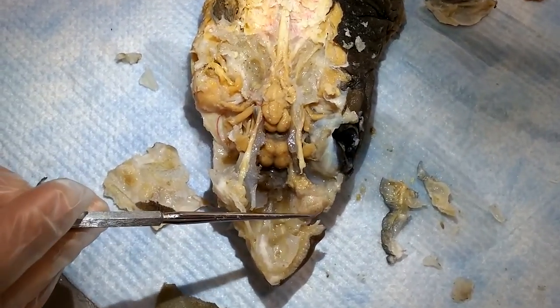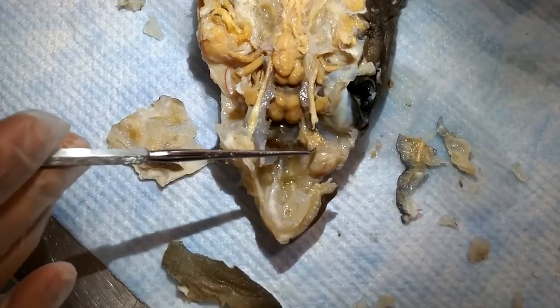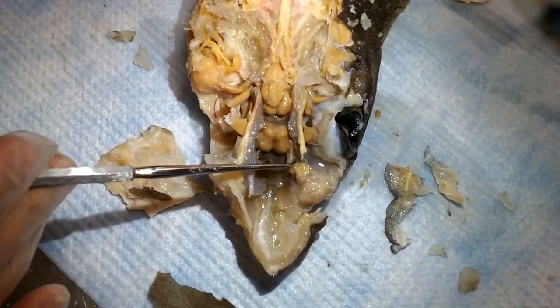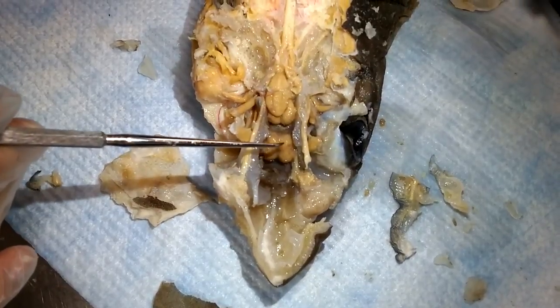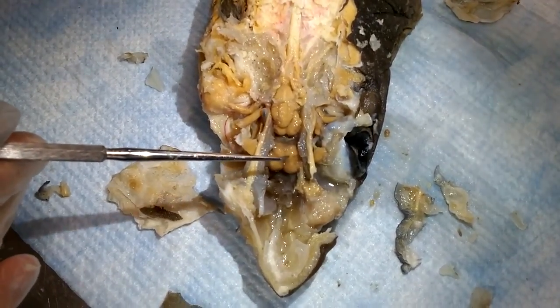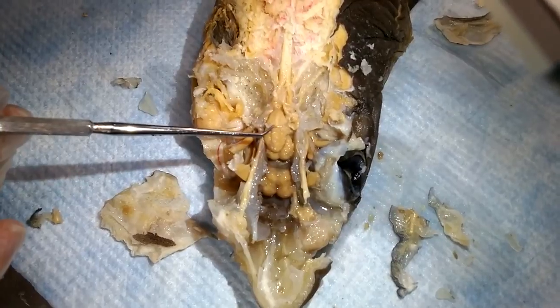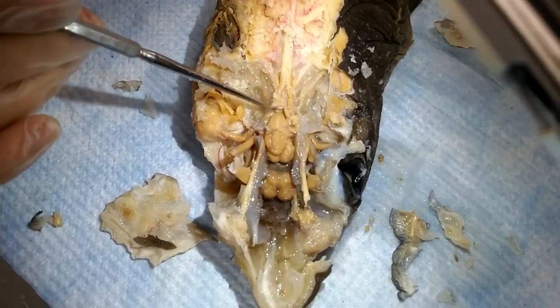This right here is the olfactory bulb, this is the olfactory tract — sorry, this right here is the olfactory lobe. This is the cerebral hemisphere. The optic lobe is right here, this is the cerebellum, and this is the medulla oblongata.